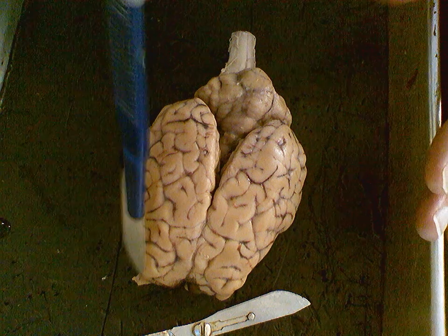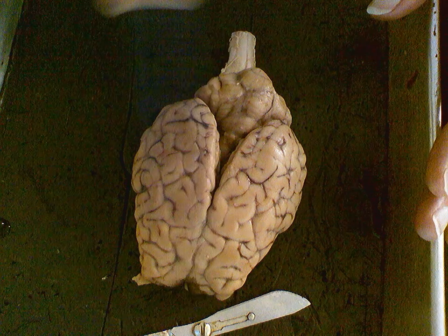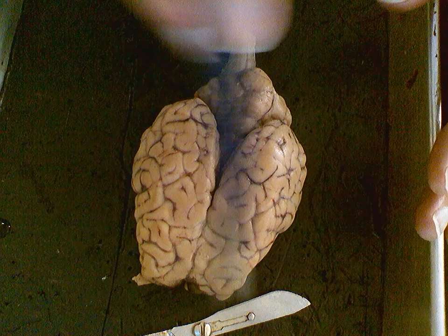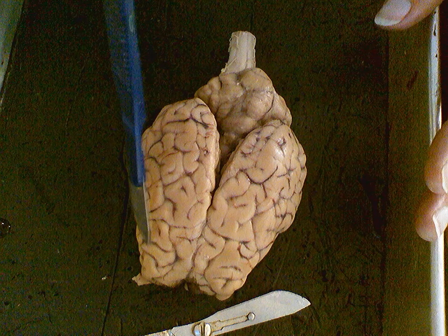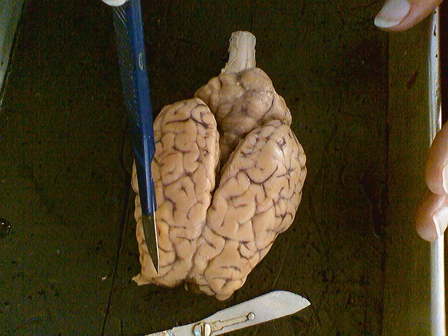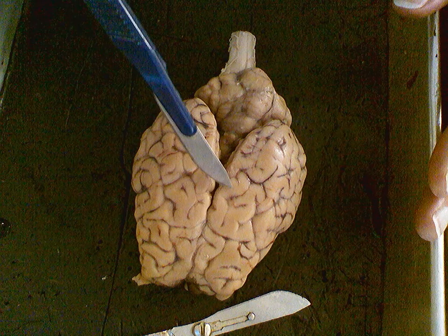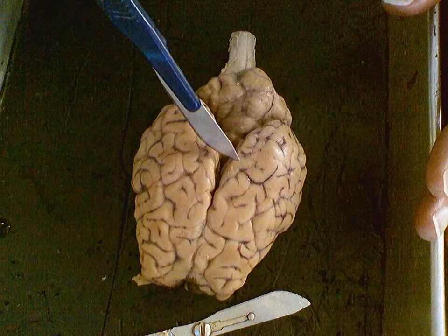So up here in the top area of the brain, we're going to call this the anterior area, or because it's toward the nose, we can also call it rostral. So we have an anterior or rostral area, and then as we proceed back toward the back half of the brain, we are going posterior, so here's toward the posterior region, or caudal, toward the tail.